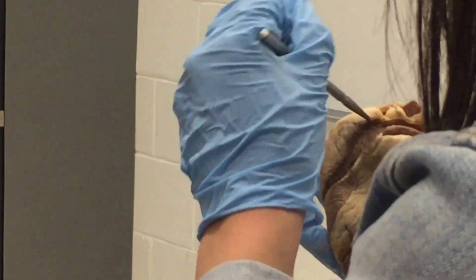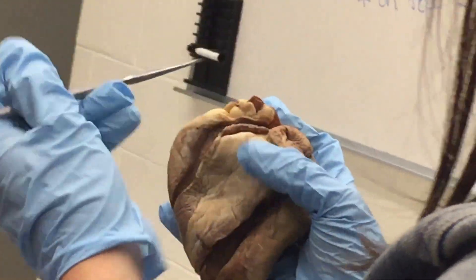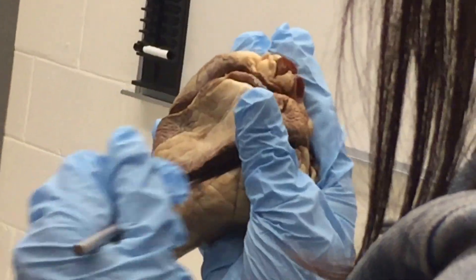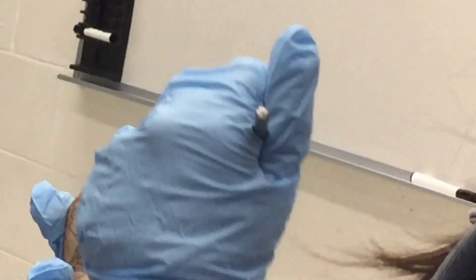So to recap: pulmonary artery, the pulmonary semilunar valve — the first valve — which you can't see on all of them, and I'm only marking ones where you can see it. Left side of the heart is thicker. Chordae tendineae, vena cava, left atrium, right atrium, aorta, superior vena cava, inferior vena cava.